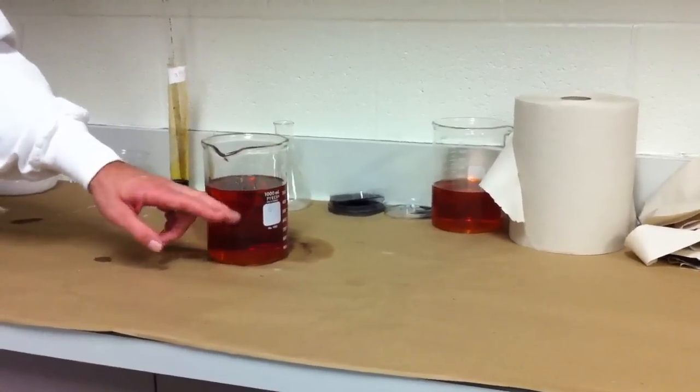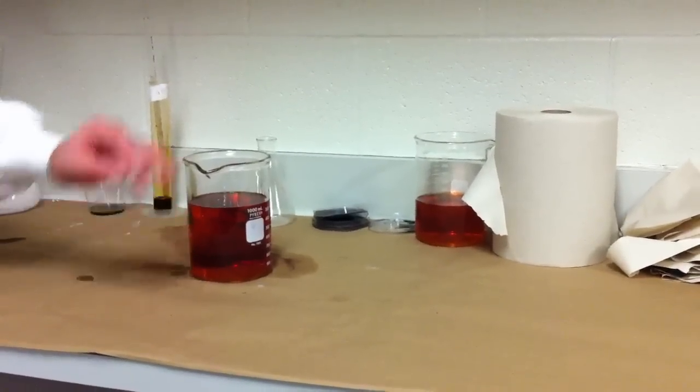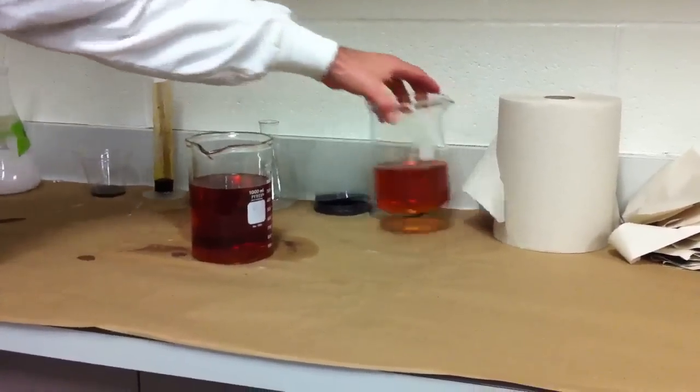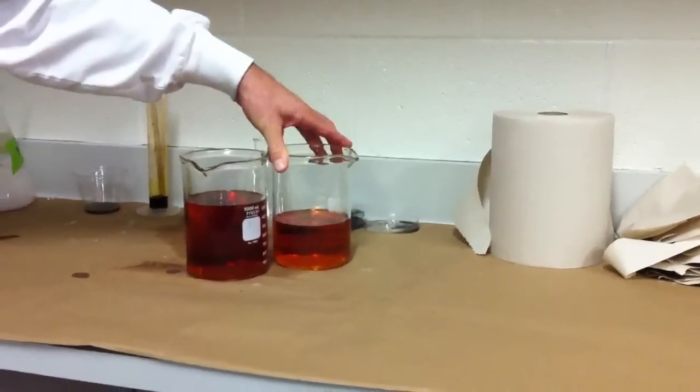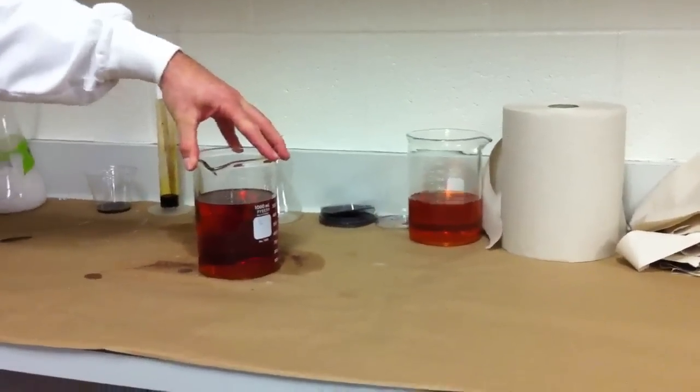Red. Yeah. Orangey red, maybe. Maybe even a slight brown tinge to it. I mean, they're slightly different because they're different concentrations. We're going to use the darker one for right now.